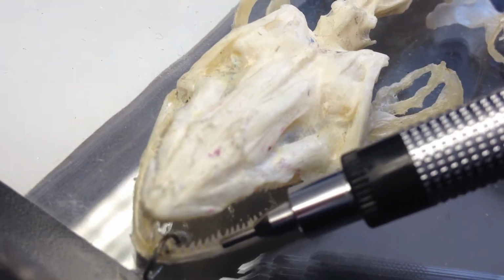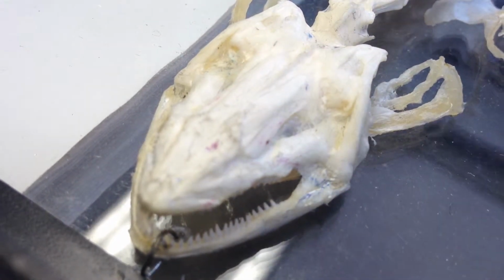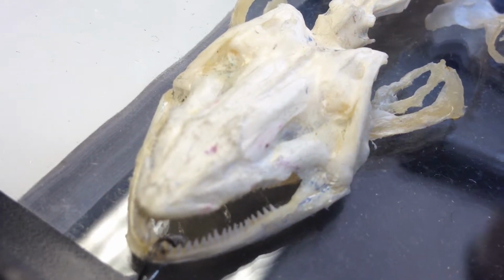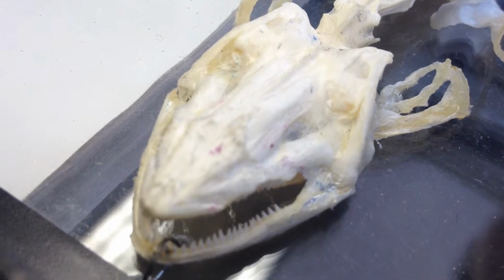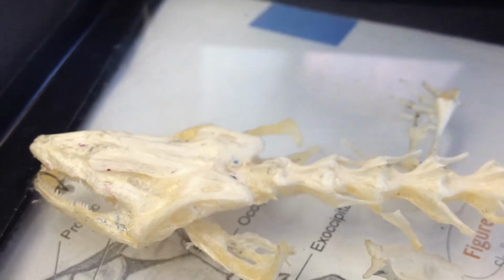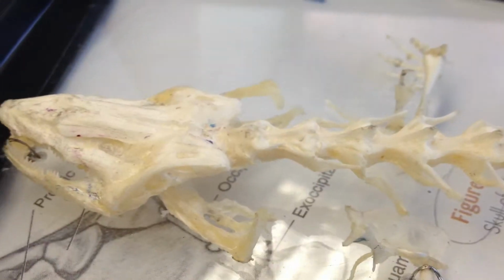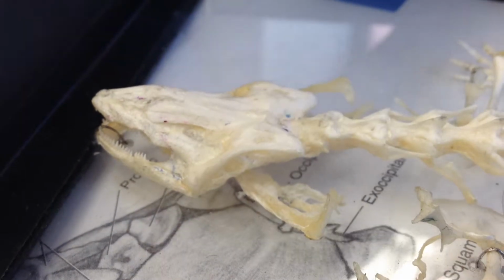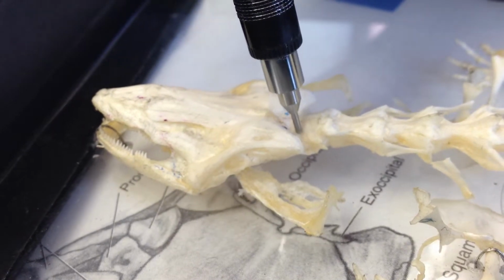put the pin right here by the dentary and say what articulates with it, the lower jaw, so you would say quadrate. And then the exoccipital is behind here. You can't really see it well, but it's around this area. And then the occipital condyle, you also can't see it either, but you can see it in the diagrams on page 55, and it's right here somewhere.